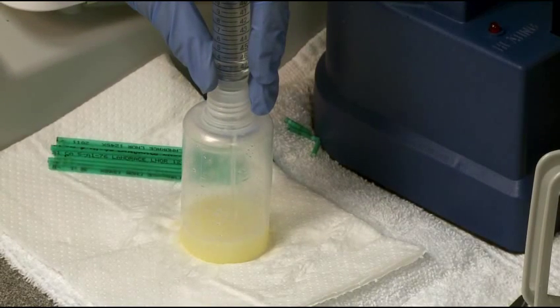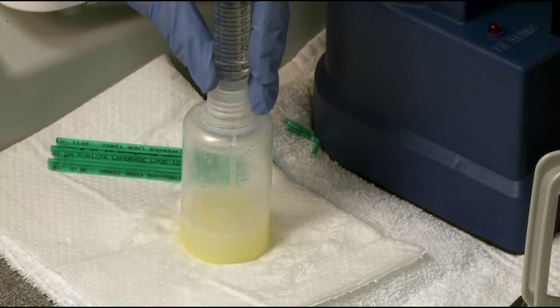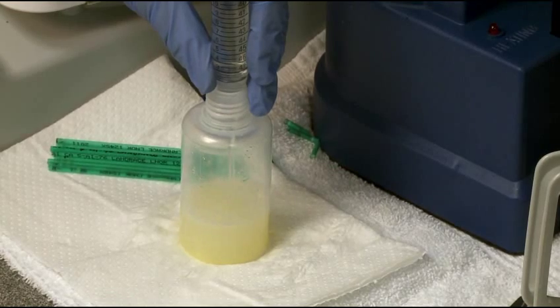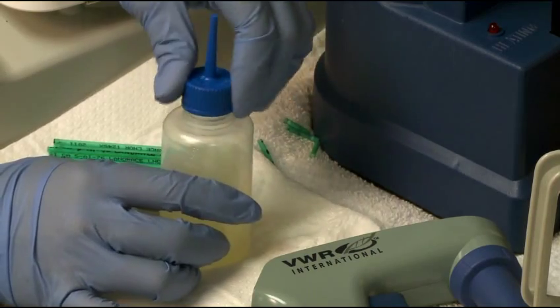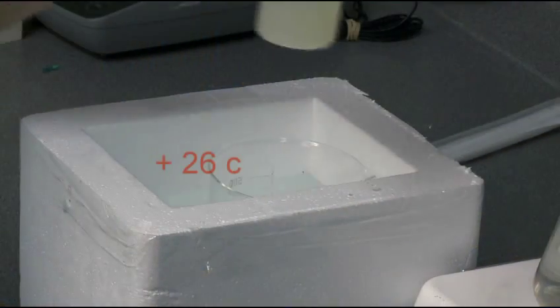Add slowly 60 milliliters of pre-warmed cryo guard thawing solution at 26 degrees Celsius. Seal the semen bottle with a cap and prepare for insemination into the sow.